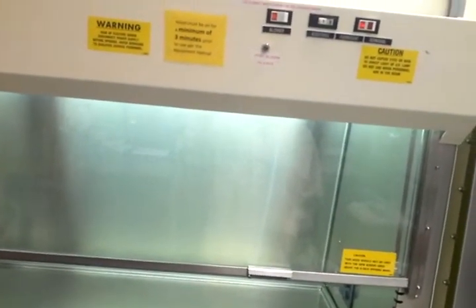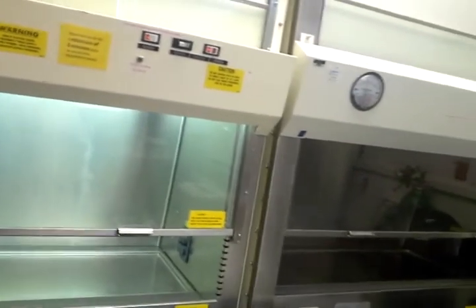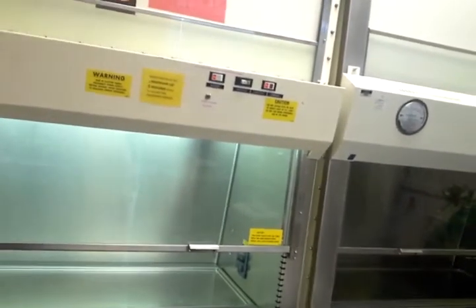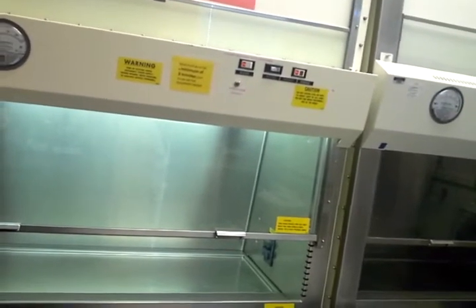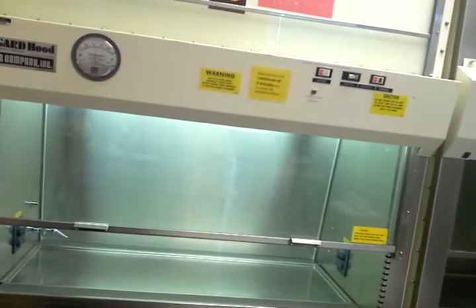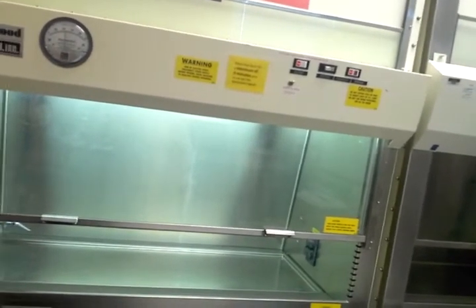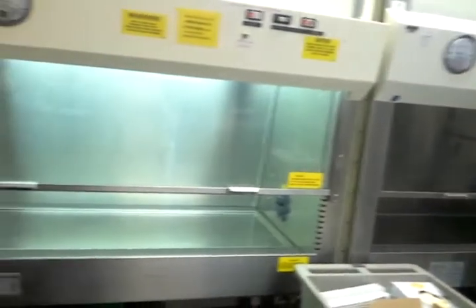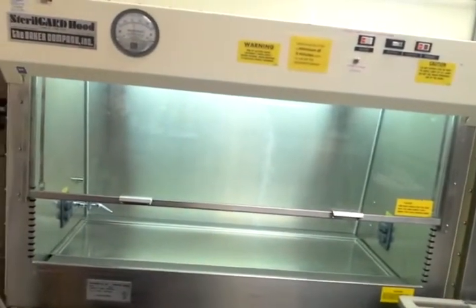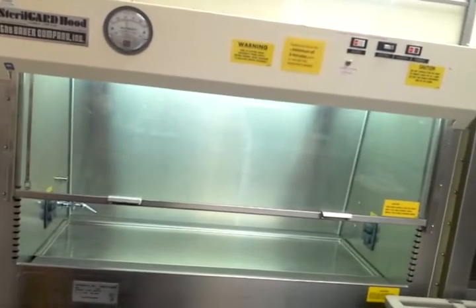As a matter of fact, today I'm working in here because it has the only equipment that I need. I must apologize for the sound in here — there's a lot of white noise coming from these pieces of equipment right here. These are safety cabinets, and there's filtered air constantly going through them.